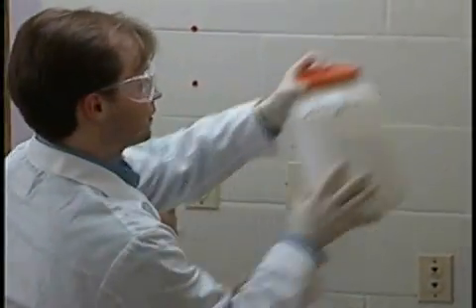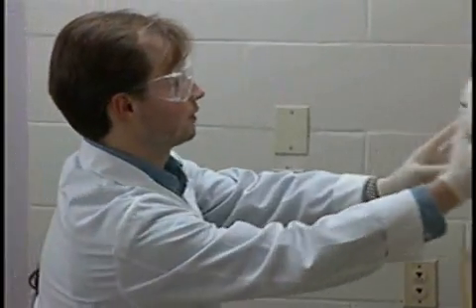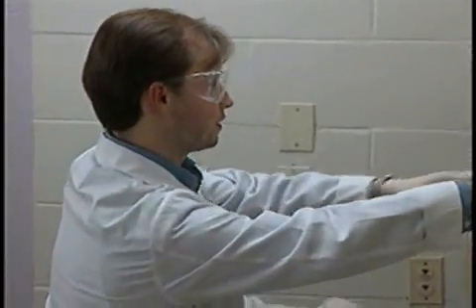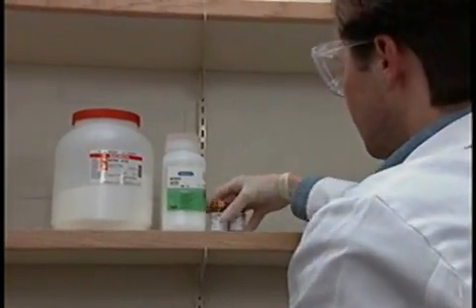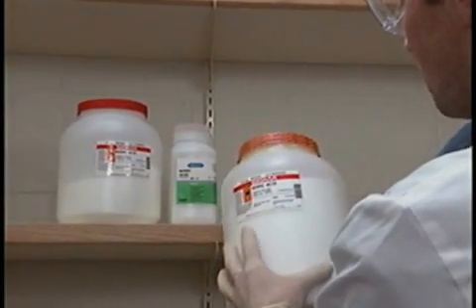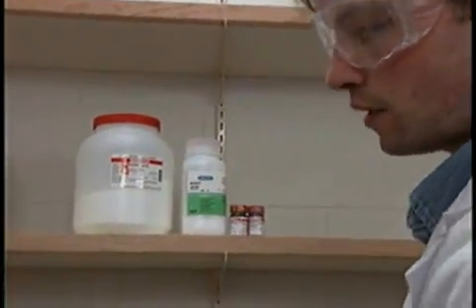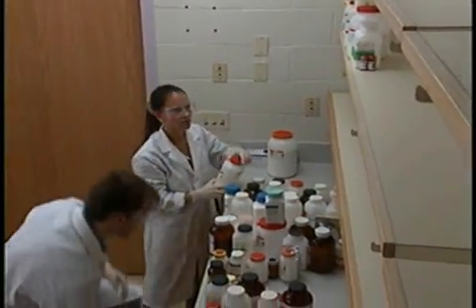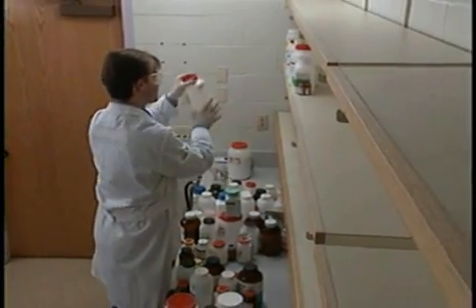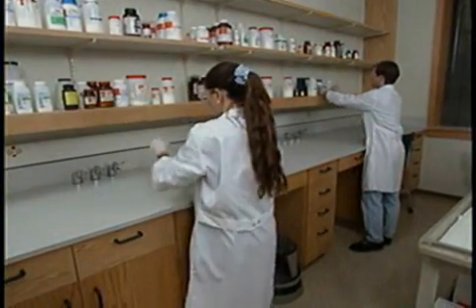The main strategy for ensuring compatibility is straightforward, based on all those principles you've been acquiring since introduction to chemistry: keep organic and inorganic chemicals segregated. There's an unopened bottle of boric acid — they've decided to return this bottle to the central storeroom. The basic rule is, don't keep more on hand than you need, especially with hazardous materials.